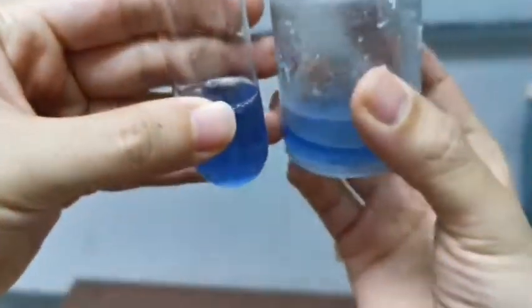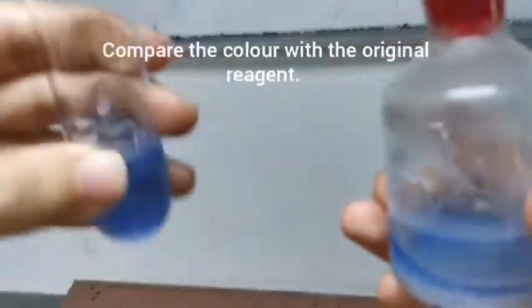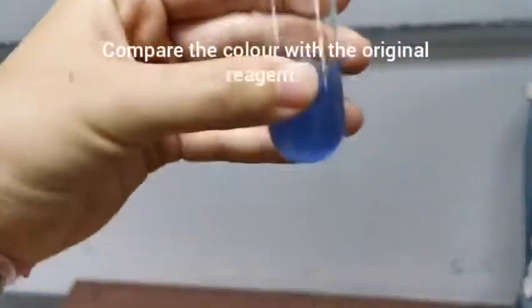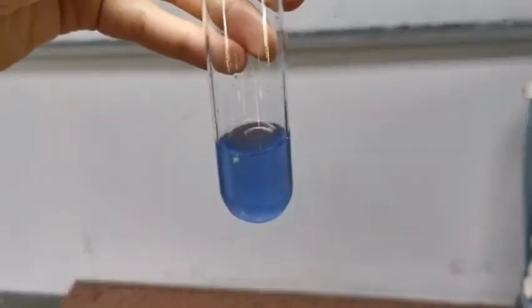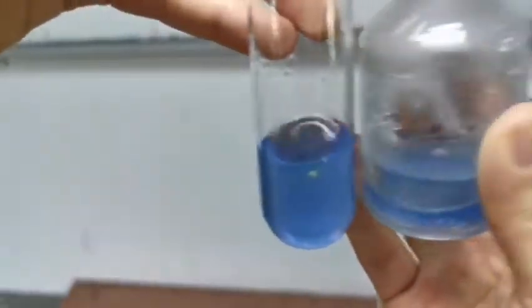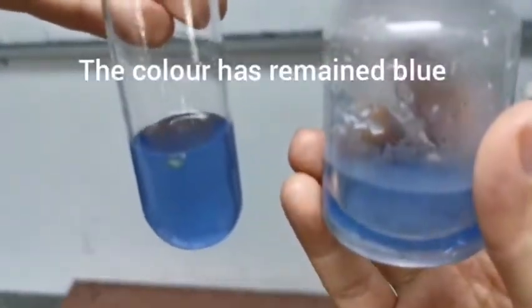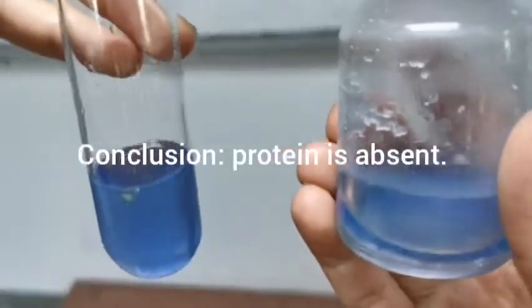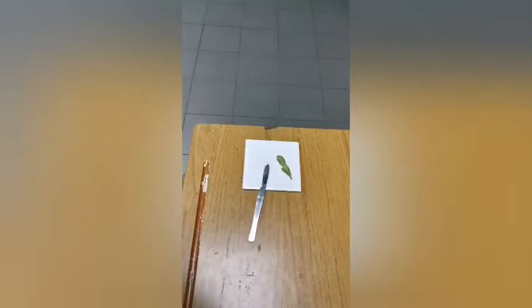If you're not sure, you can bring the color up for comparison. Shake it. Has the color turned from blue to purple? It hasn't changed. So we can say that there is no protein present in this food specimen.